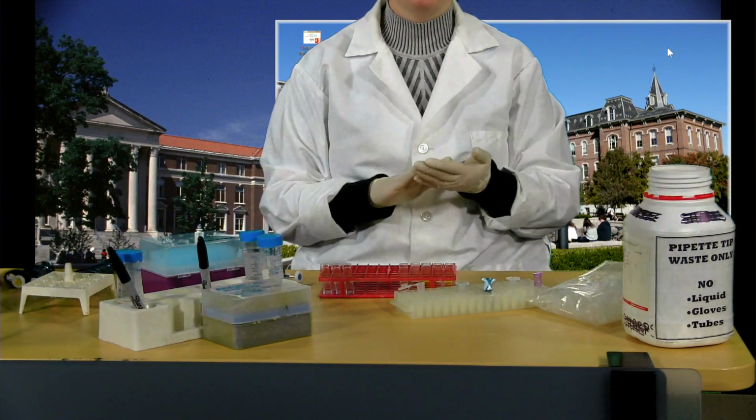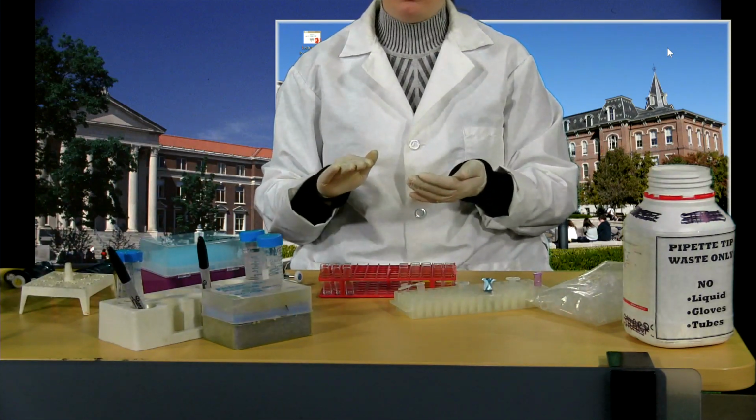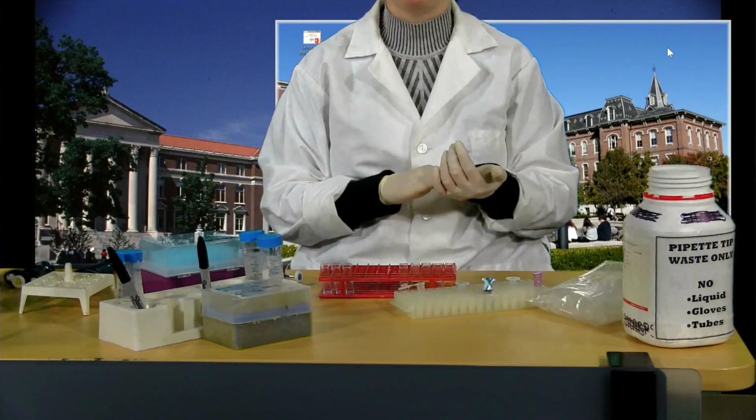That's going to be a good guideline for you when you're doing this in your exam. Think about how long it should take me to do this, and just use it as a guideline. If you go a little bit over, then that's fine, but you do want to be a little bit cognizant of the time, because that is one of the things that you are being assessed on.